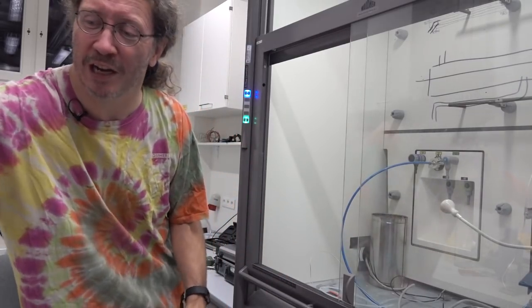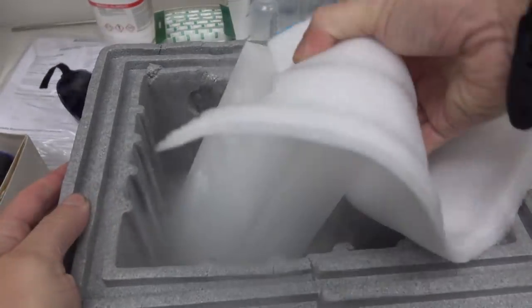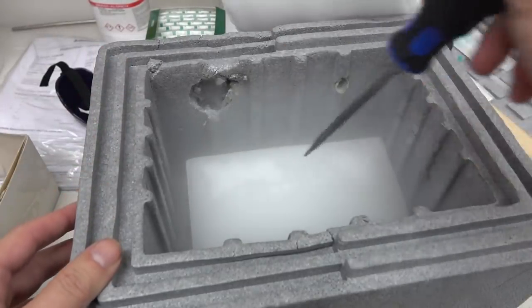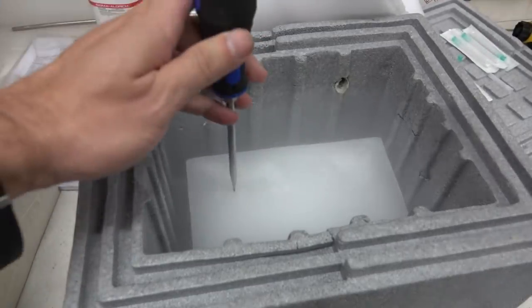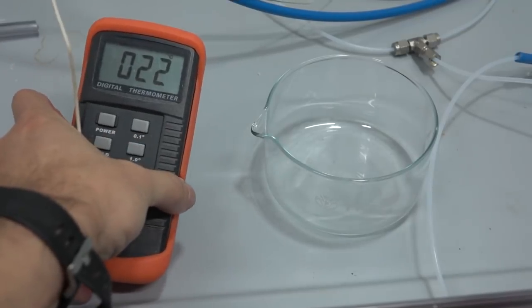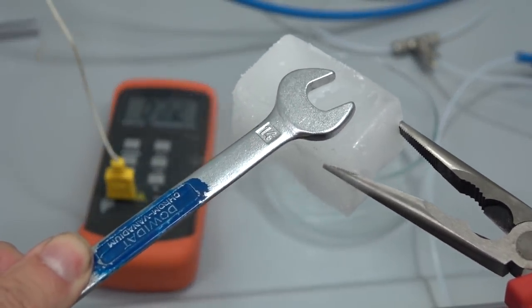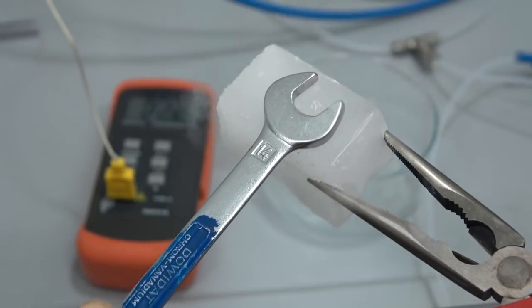So how do you make ammonia into a liquid? There are two principal ways: the first is you get it really cold, which you would do with a block of carbon dioxide, or you can pressurize it in a cylinder. You can just about move dry ice with your bare hands but you get frostbite really quickly. You can just break up your carbon dioxide like this. Here I've got a thermometer — it's 22 degrees Celsius at the moment, room temperature. That's a block of carbon dioxide — that's basically the gas vaporizing.